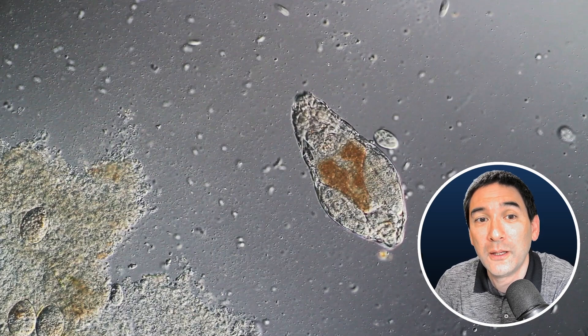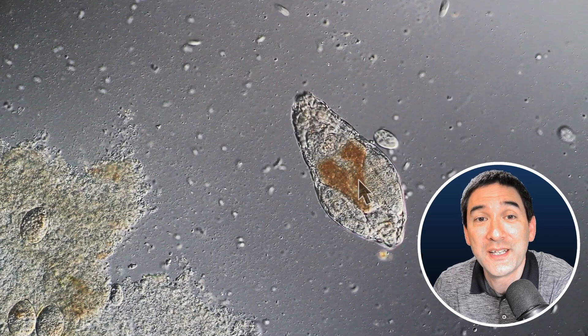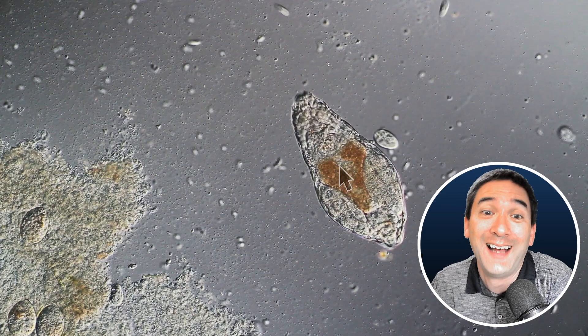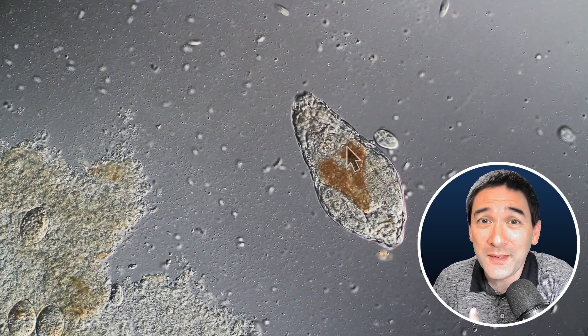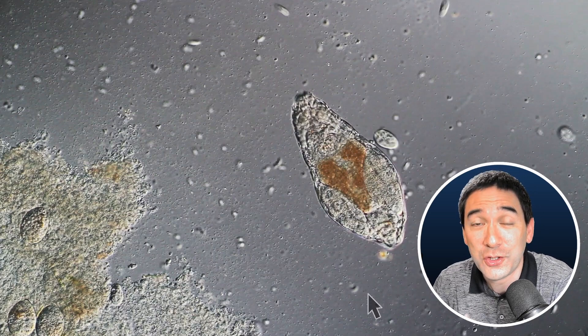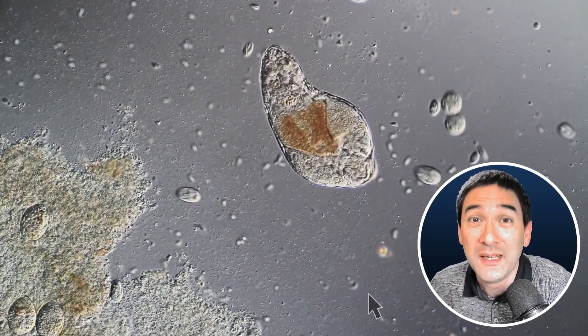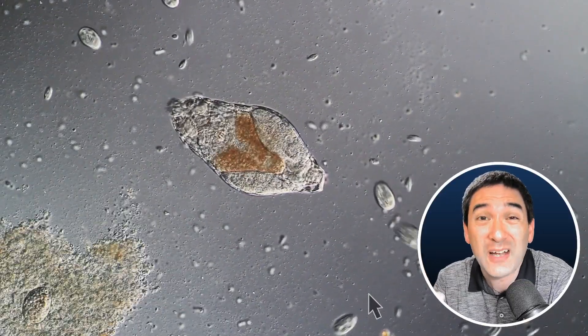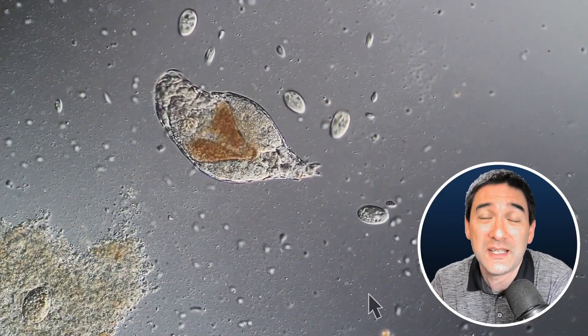So you would not be able to see it, the same as we have over here. And the reason why we're able to see this whole rotifer at all is because overall the refractive index of all of those cells here is different than the surrounding medium, and also because it has eaten something and we're able to see a different color in here. This is actually the reason. And back in the 19th century, when they first systematically analyzed organisms, they were actually very fascinated by plants, because plants actually have a cell wall on the outside, and the cell wall can be easily seen with a microscope. But the cell membrane is too thin — you actually need electron microscopes, which didn't exist at that time, to be able to see the cell membrane.